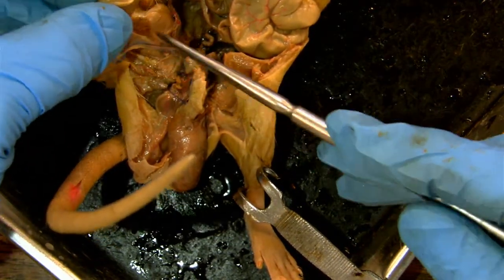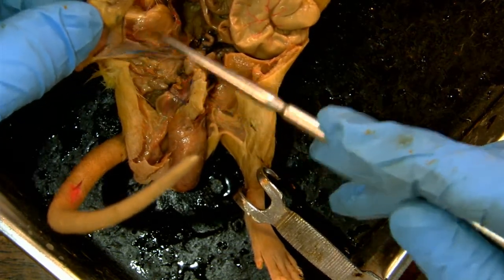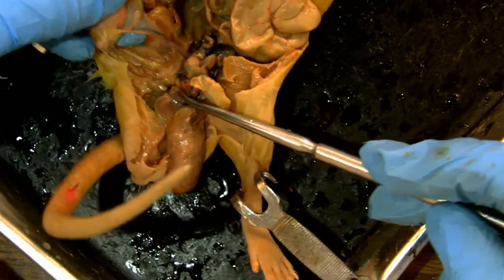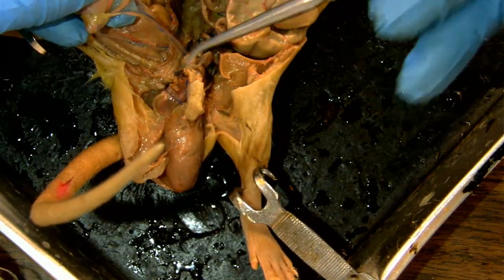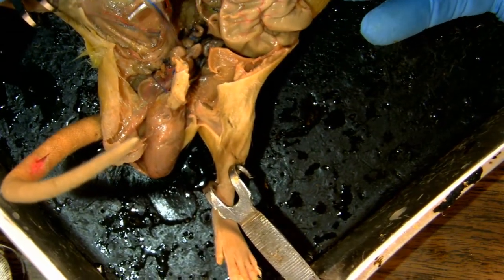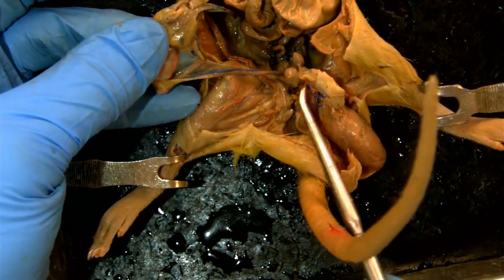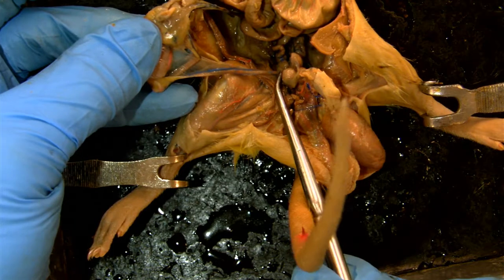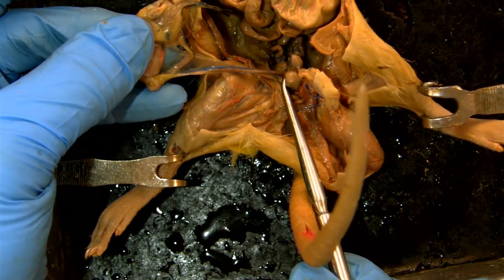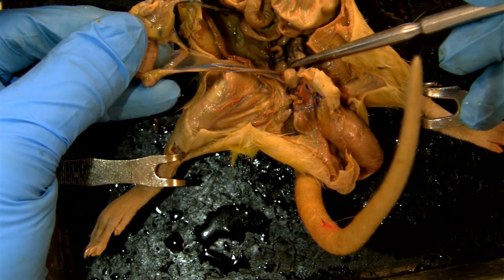The testis is attached to the penis to allow transport of seminal and reproductive fluids by way of what we call the vas deferens. Here's the vas right here, and you can see how it connects in by the urethra, where the urethra, the bladder, and the penis all join just down in here.